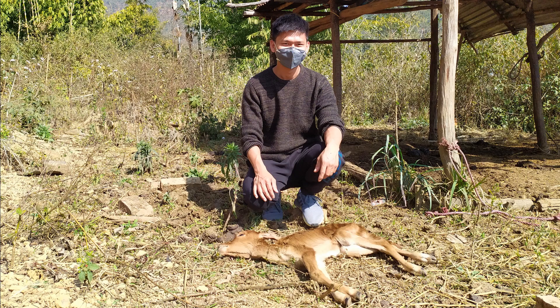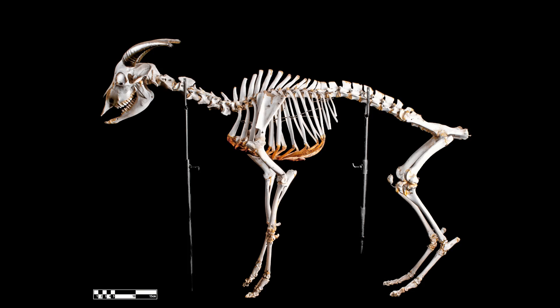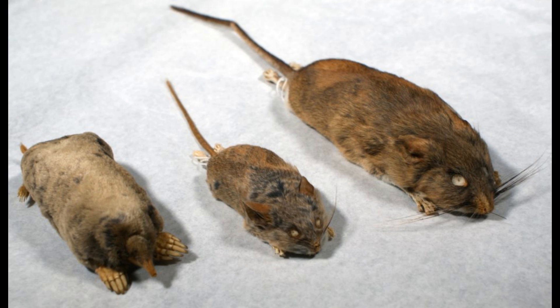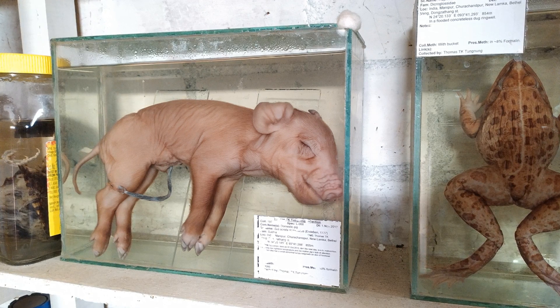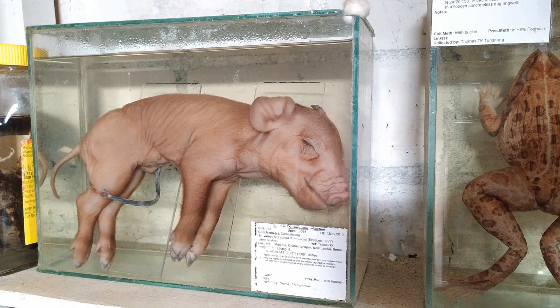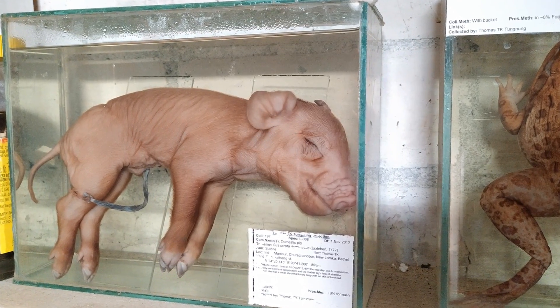There are a handful of ways by which you can preserve a large mammal. You can obtain the skeleton, make a cool taxidermy, make a study skin mount, or even make a wet specimen out of it. I've always wanted to add a large animal wet specimen to my collection, hence this video tutorial.